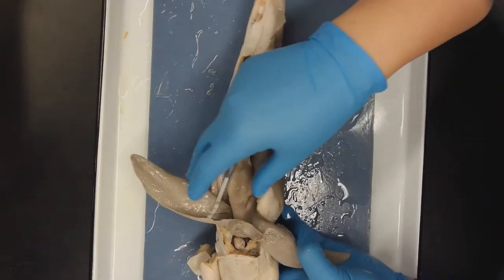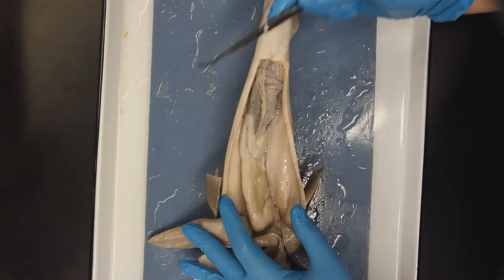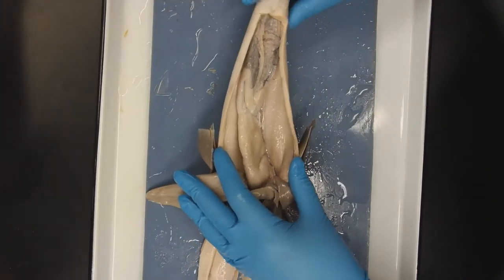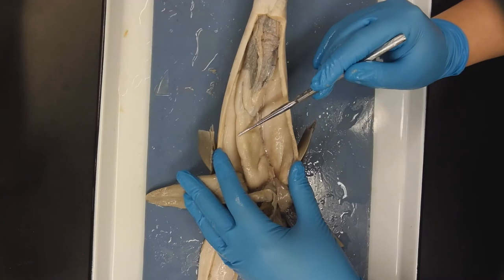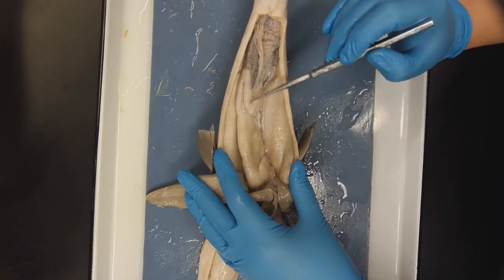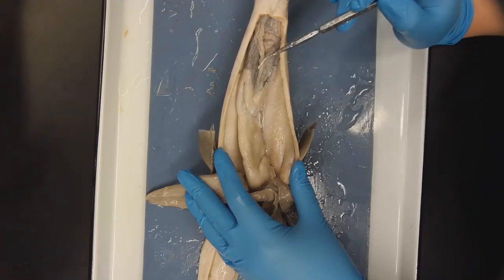And once we get that removed out of the way, we can see the esophagus, which then will lead into our stomach. So again, this is our esophagus leading into the stomach, followed by our small intestine or duodenum, and this is an easily identified structure just because of its characteristic J shape.